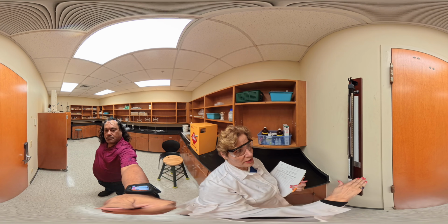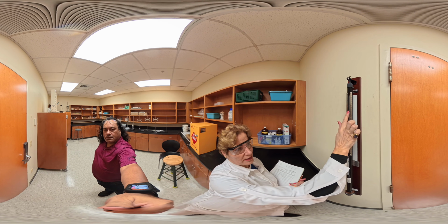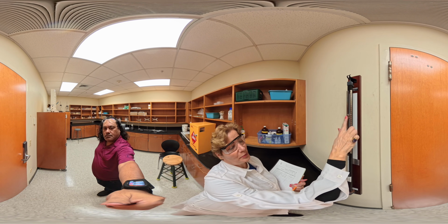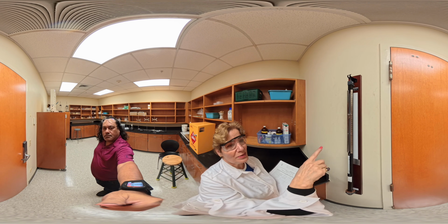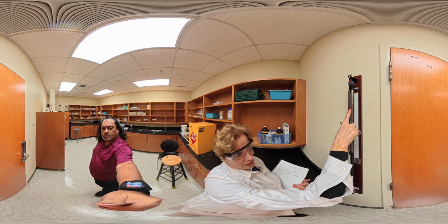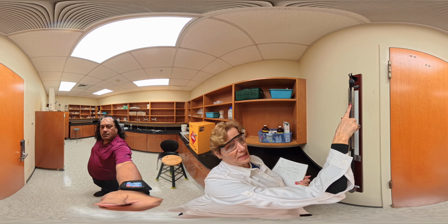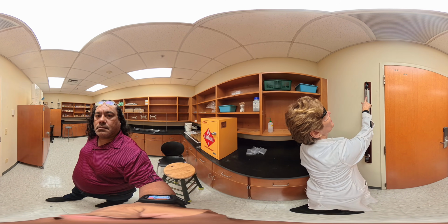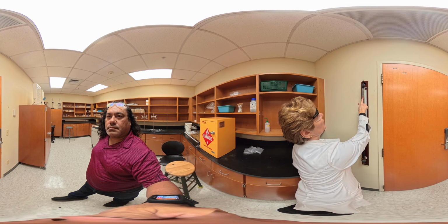If there's more pressure, the mercury would go higher, and we read that level. This has nothing to do with the pressure outside of this room or this lab. What we are measuring here is the pressure for this room. Normally sea level is 760. This is very close to it.